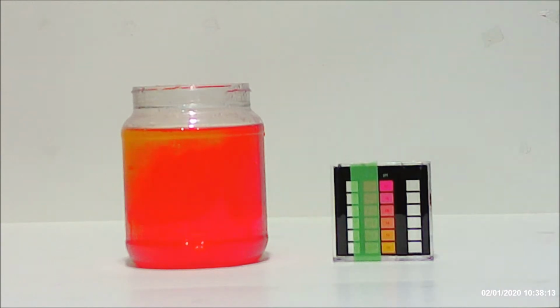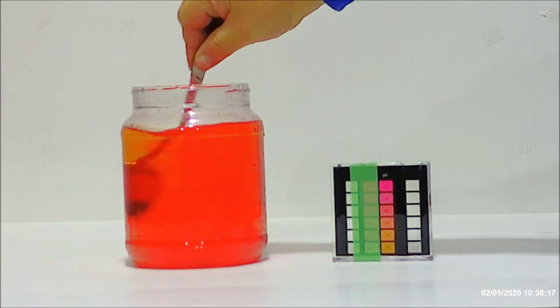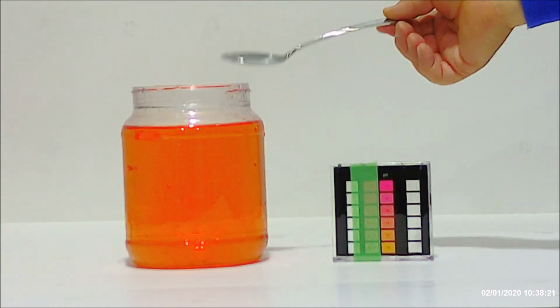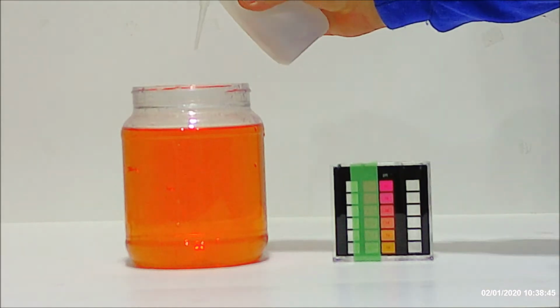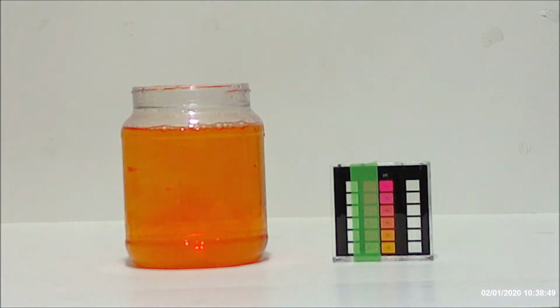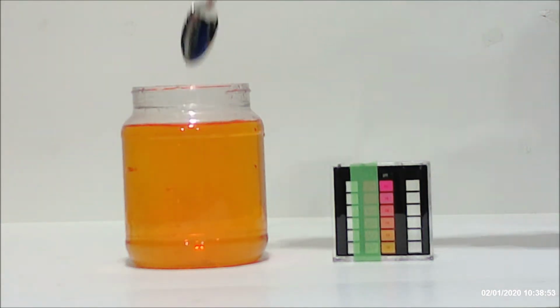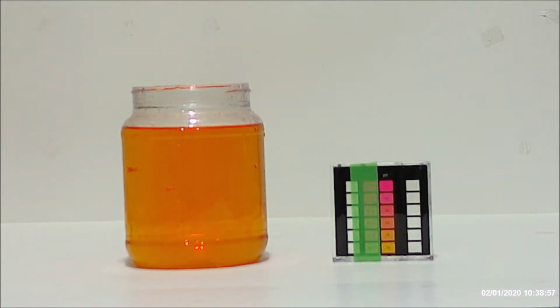So as you can see, the acid is starting to take effect. We're getting a little bit of a yellow layer. When we mix it in, we go into the oranges. So we're going to end up having to add a little bit more because we want it down at the very bottom there at the little pea colored yellow part. So we're going to give it another little blast of acid and a stir. And now we have a nice yellow. So we know that the pH in that water is very low.